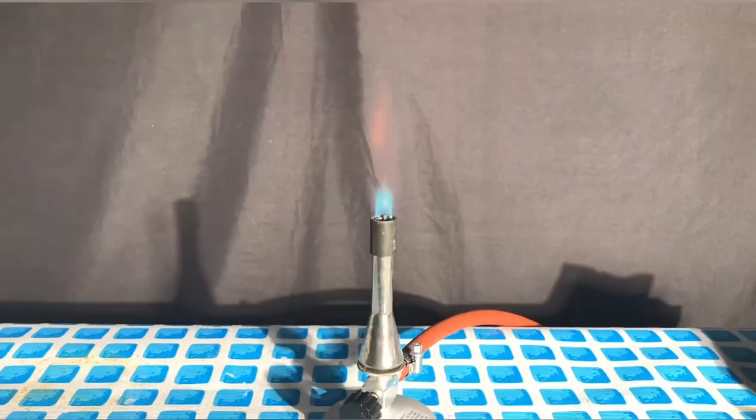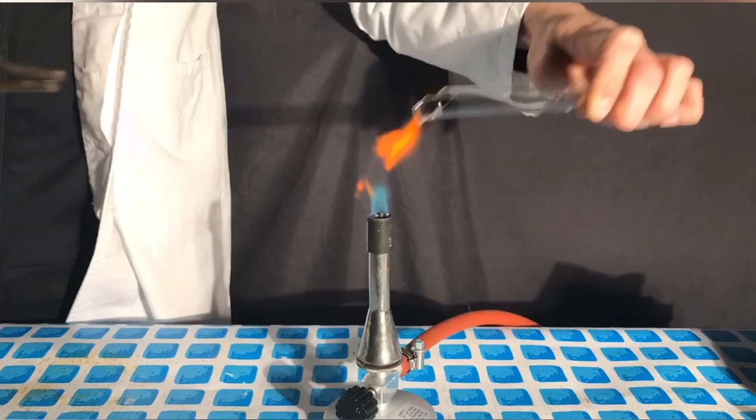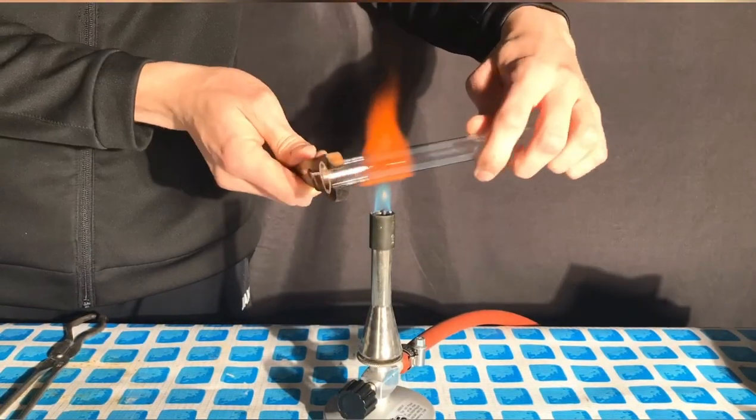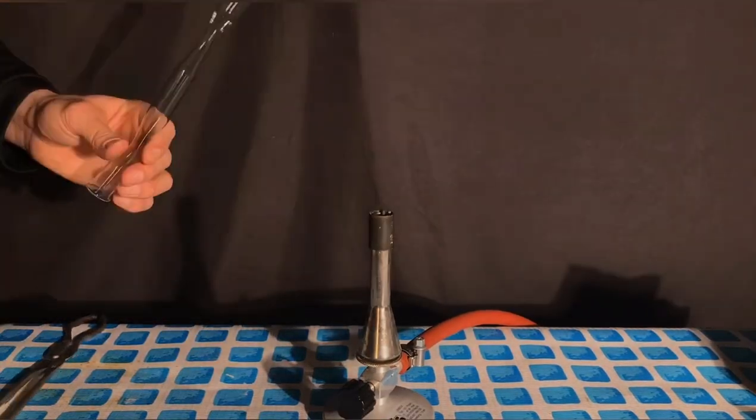We prepared a double sided test tube ampoule using a Bunsen burner, but in the end it broke. Having learned from my mistakes, this time I used a wooden clamp and it worked well. No broken glassware and the perfect ampoule.